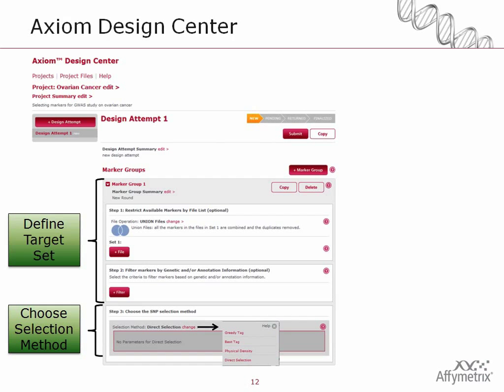So this is how you set up one marker group. But we recognize, as part of a design attempt, that you're likely to have more than one target set of SNPs that you're interested in. This collection of genes, and then a second set of genes. And you may not want to use the same selection method, or you may not want to use the same filters associated with them. So we've enabled you to define multiple marker groups as part of a single design attempt. You can do that either by clicking the plus marker group or by copying the existing marker group and then simply editing it. More details of this and an actual use of this will be shown in part 2 of the video, where you can see me go through a hypothetical design for a cancer GWAS and use all these buttons.